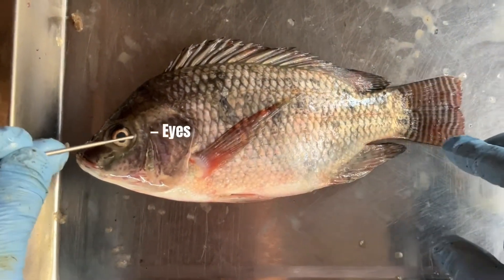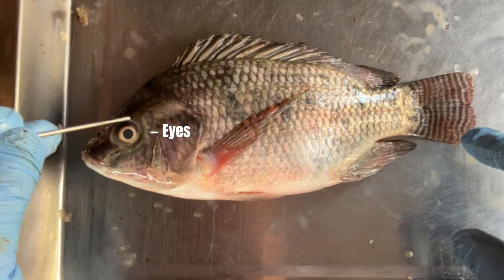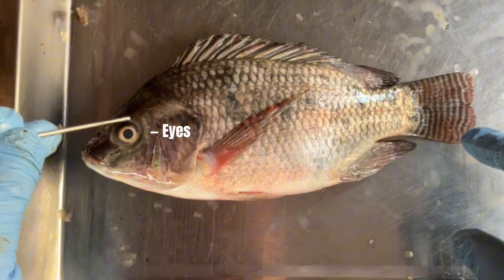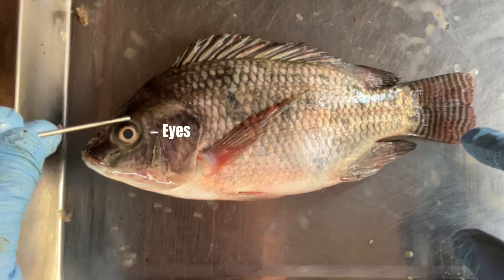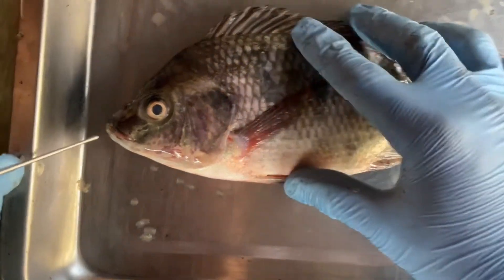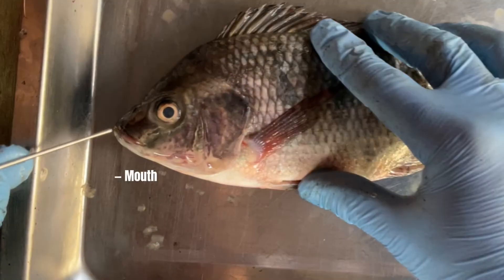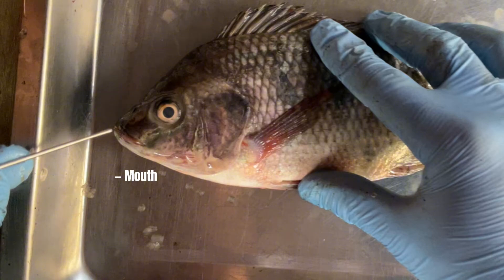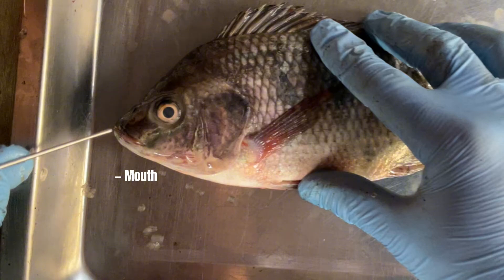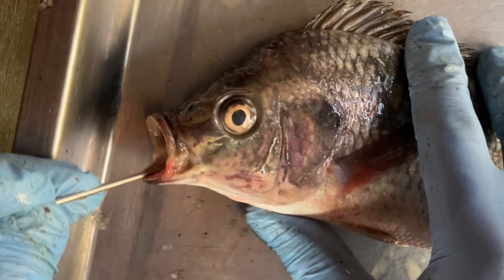Eyes provide vision for locating prey, avoiding predators, and navigating the environment. Tilapia have well-developed eyes adapted for both diurnal and nocturnal vision. The mouth is used for feeding by capturing and processing food items, and varies in shape and size depending on the feeding habits of the tilapia species.